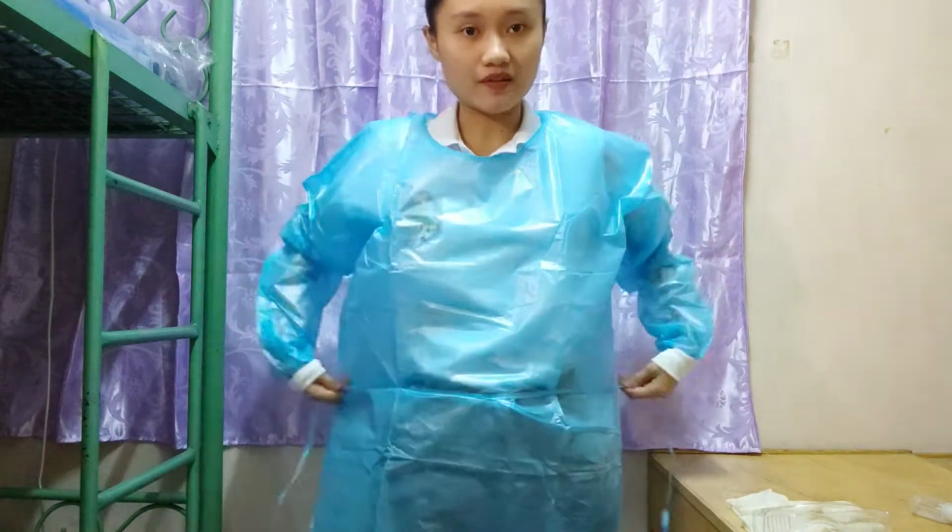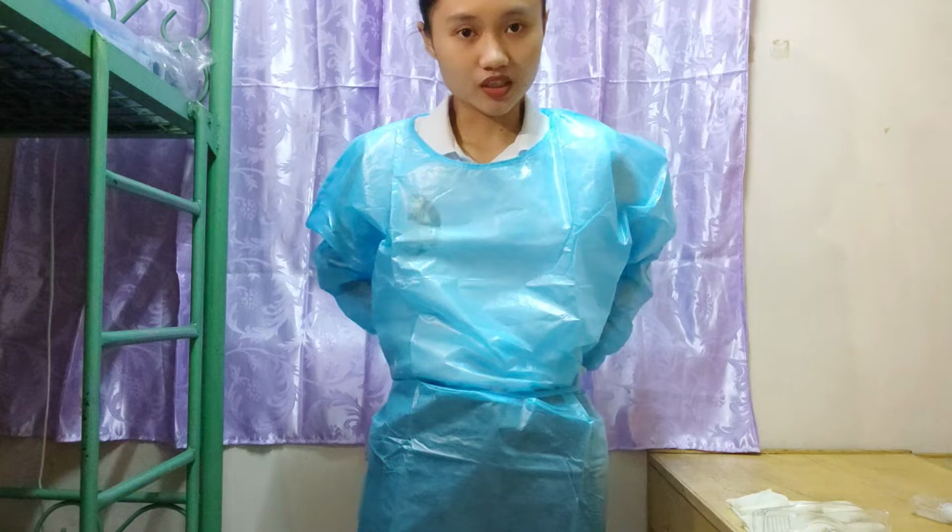As you can see, I am having a hard time putting on the PPE since it is big on me. And make sure in acquiring a PPE, you have the right size so that there will be no microorganism that can enter in the space. But since this is what I have available, we will make do with it.